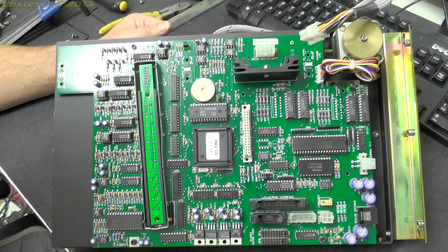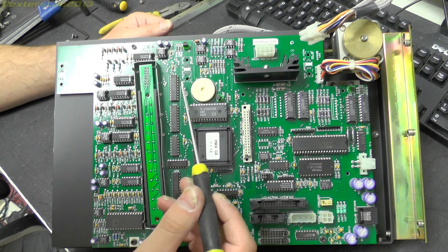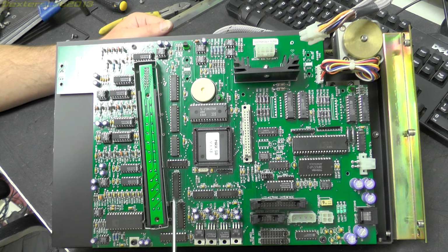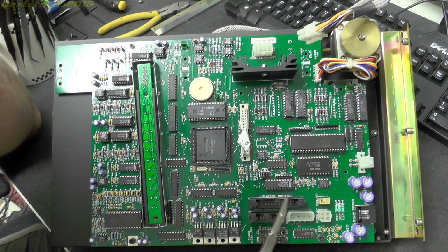I wouldn't have thought that speed would be much of a necessity in this, but they might sample it over a number of seconds to get an average or something like that. So that's just a 14-bit ADC, which will then run up and be processed, presumably by whatever that is. I'll peel the label off that in a moment. Just here we've got a number of 74 series logic, probably some little glue logic to work with the ADC.